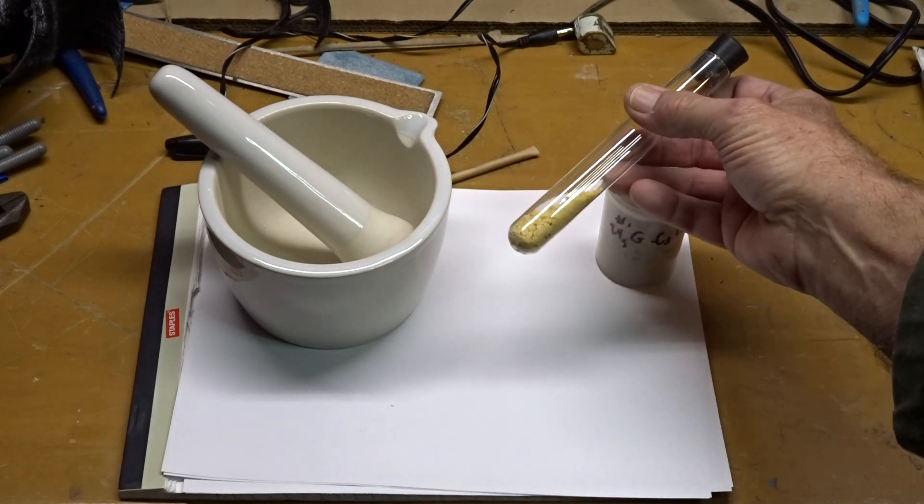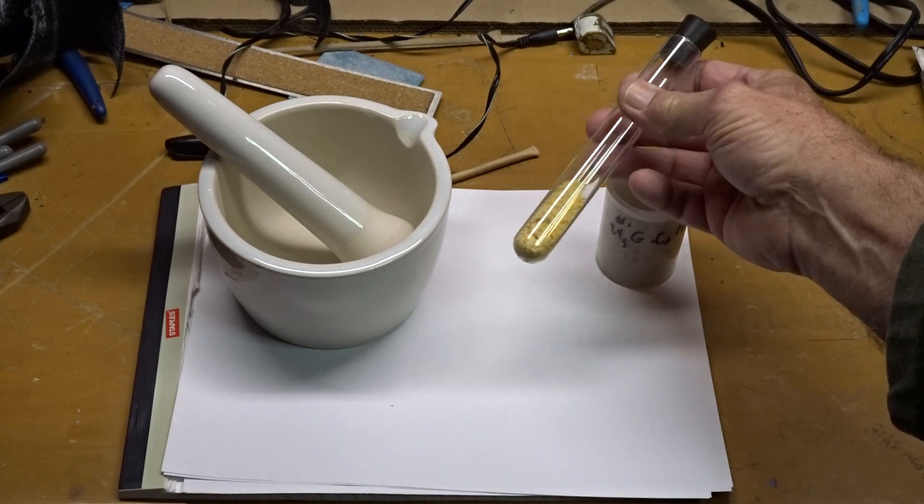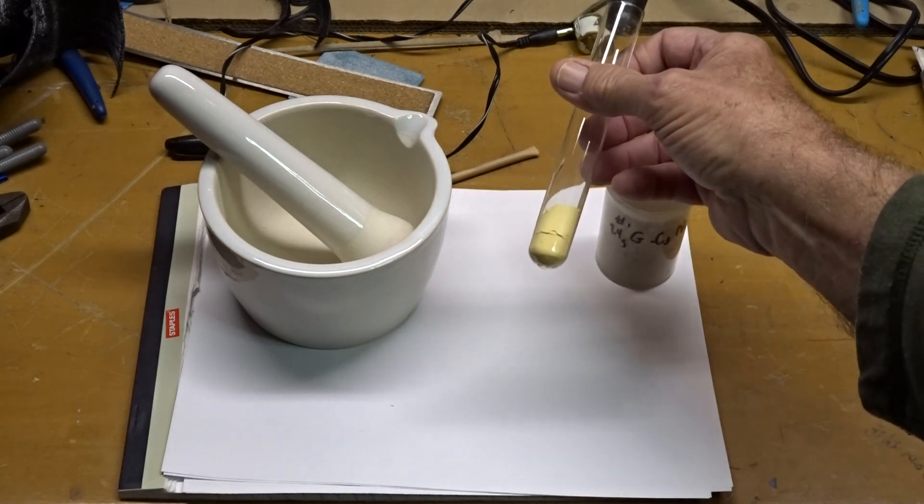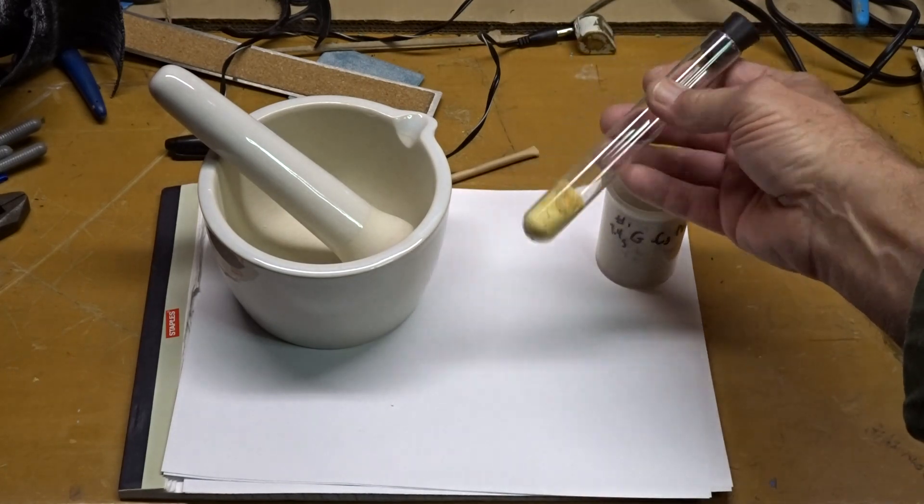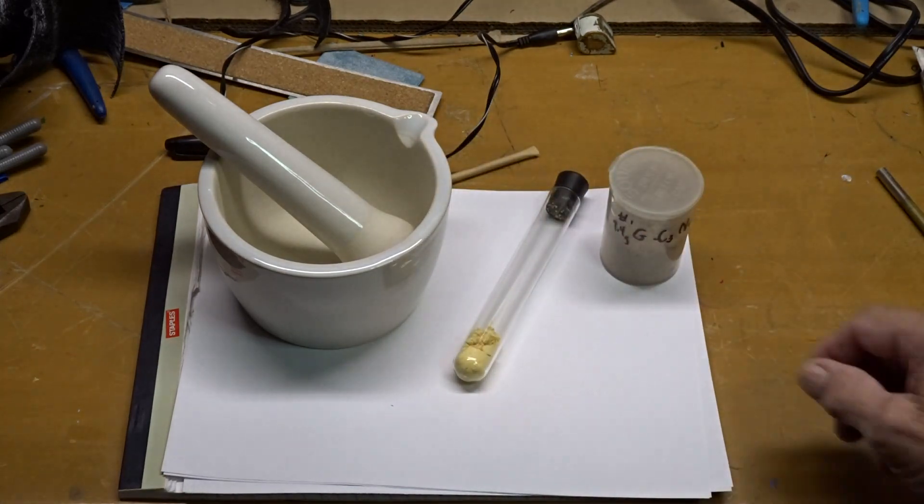This was 560 degrees, 20 grams of thiourea down to 2.25 grams of graphitic carbon nitride, and then I ground it for five minutes by hand.